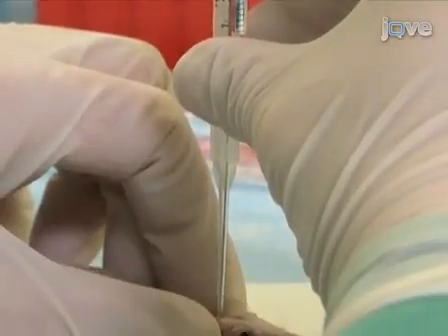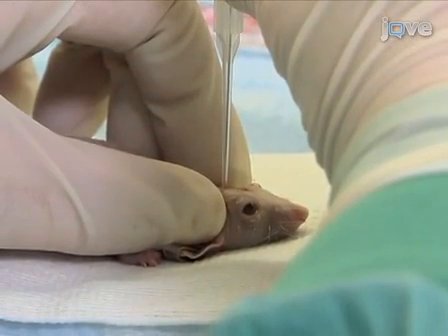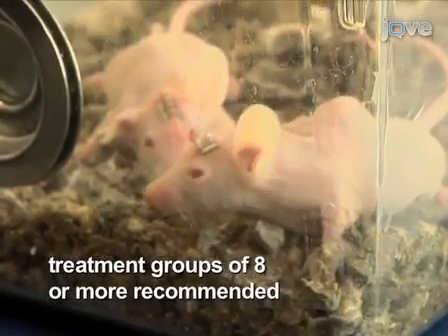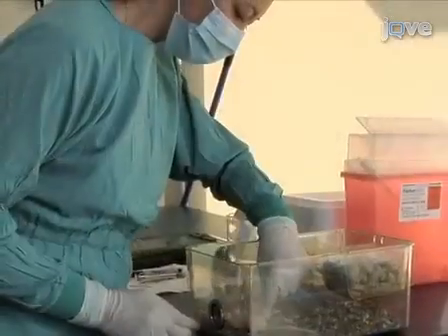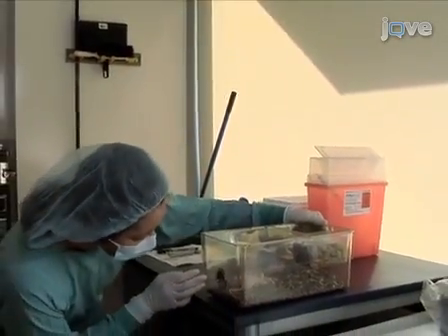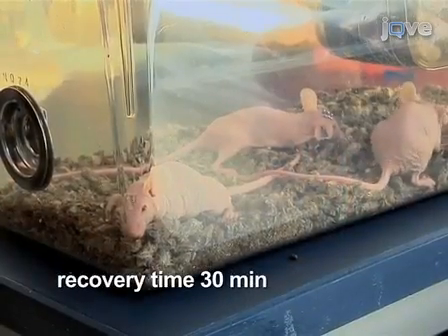Be sure to mix the cells between injections to maintain appropriate concentration among the members of an injection series. Treatment groups of at least 8 are recommended to help ensure results that are statistically meaningful. Monitor all of the mice post-operatively until they become ambulant and regain normal activity. Typically, recovery time is around 30 minutes.